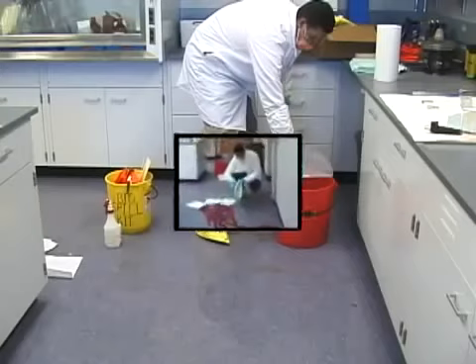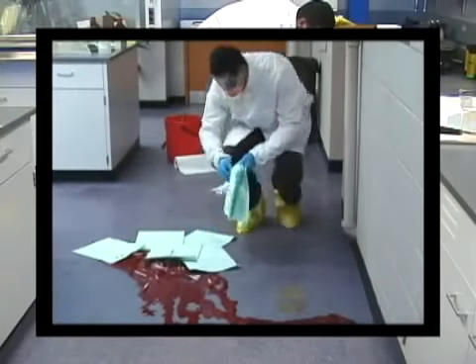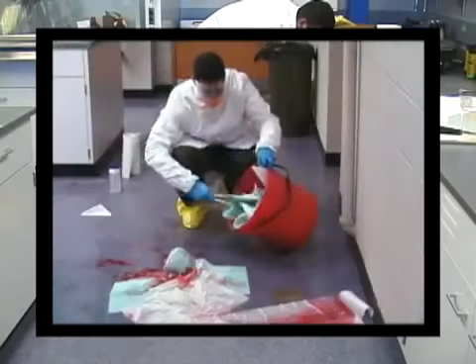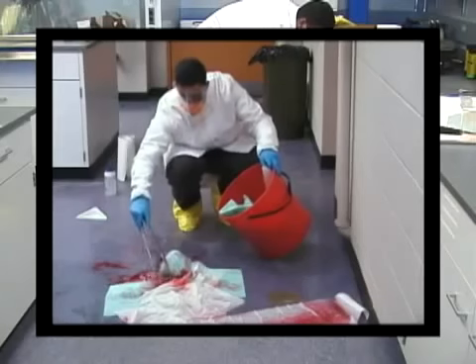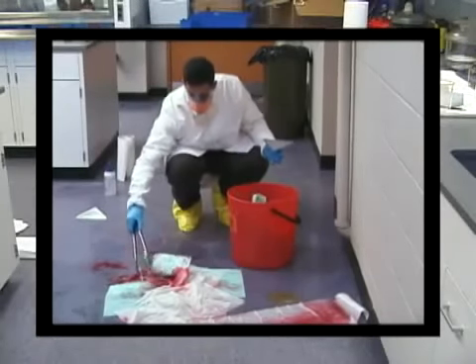Please note, if this was a high-risk blood spill or a spill of an infectious agent, the absorbent material would have been placed over the sharps, the disinfectant added, and sharps, together with the absorbent material, disposed of in a sharps container. This procedure decreases the risk of handling sharps prior to disinfection.